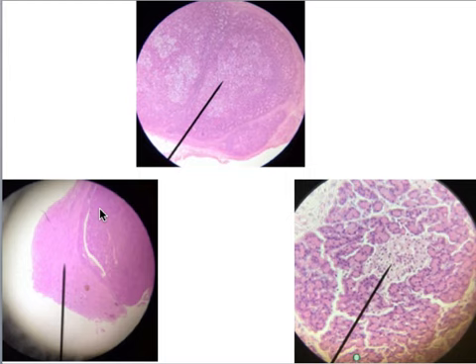The anterior pituitary gland is going to be darker and it's going to look denser. If you remember, the anterior pituitary gland has cells that secrete their own hormones. So this is going to be very full of cells that are going to secrete hormones.